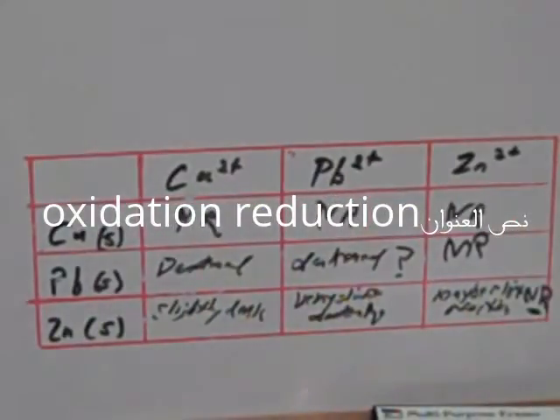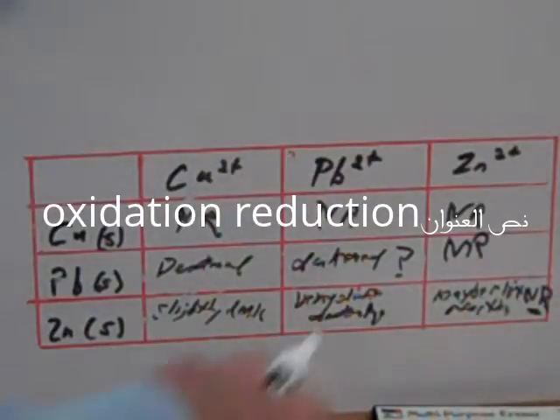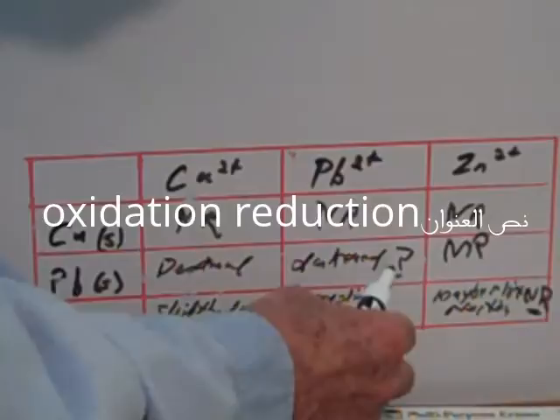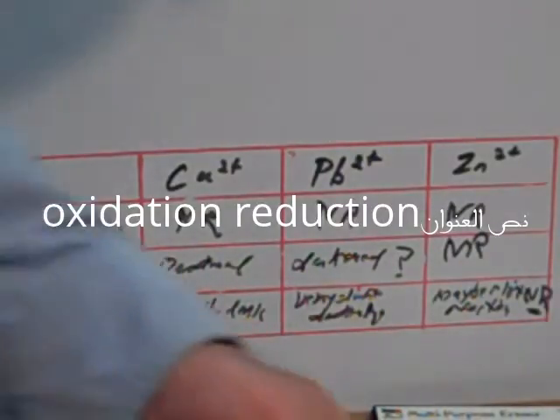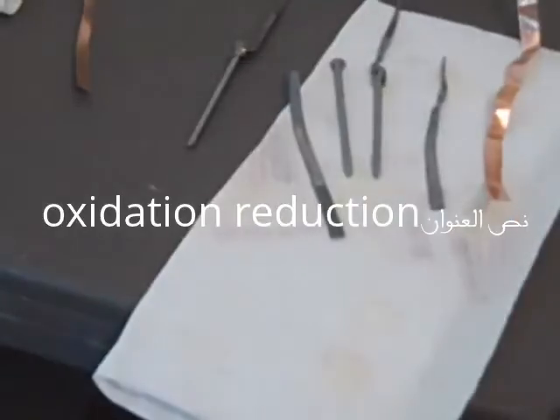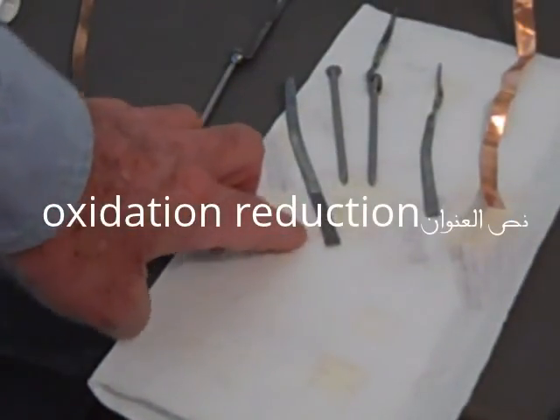And here it is. You can see it right there, on the edge. The darkened lead down the bottom.